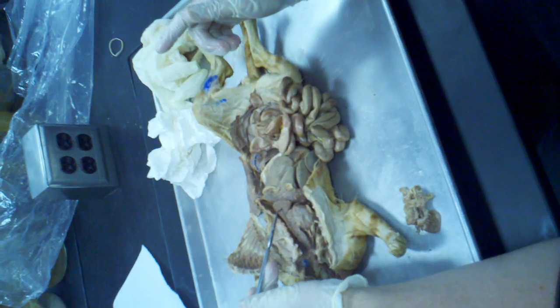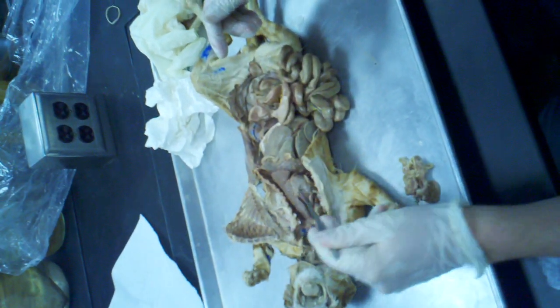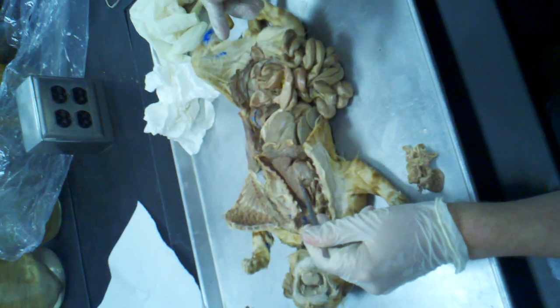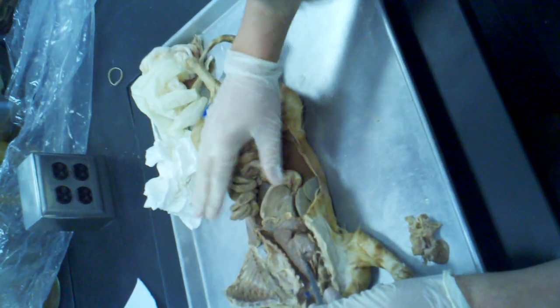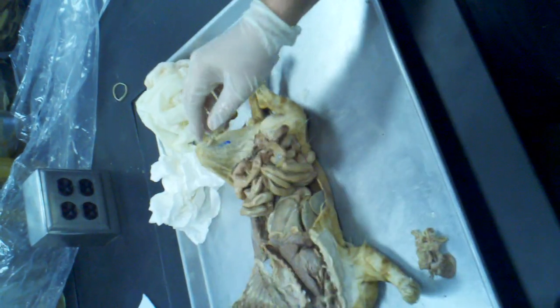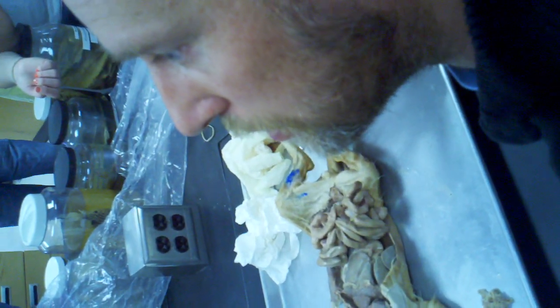So the connective tissue on the lungs, anywhere, any of these lobes of the lungs, is called visceral pleura, as opposed to parietal pleura. If I poke right on the heart, not on this sac, that would be visceral pericardium, right? Visceral peritoneum would be any of these organs with their protective outer layer. So it could be here, it could be there, it could be anywhere here. So know the difference between viscera and parietal. Okay, so that we got the lungs, the pericardial cavity, ventricles, and atria.